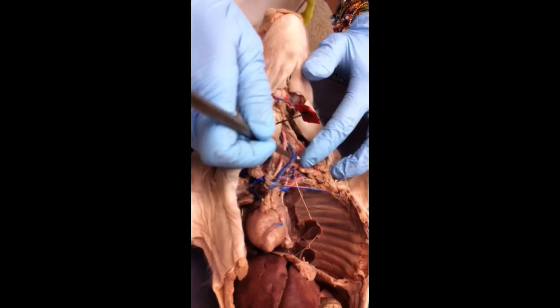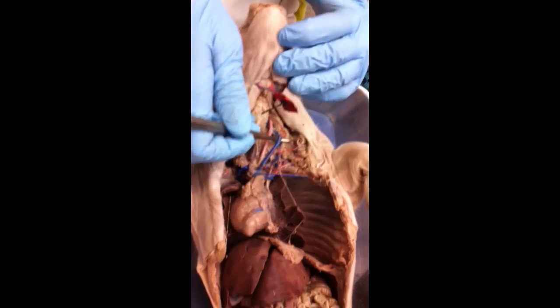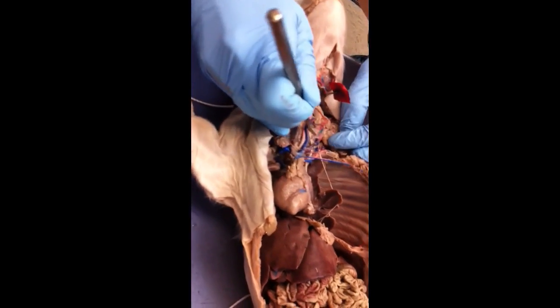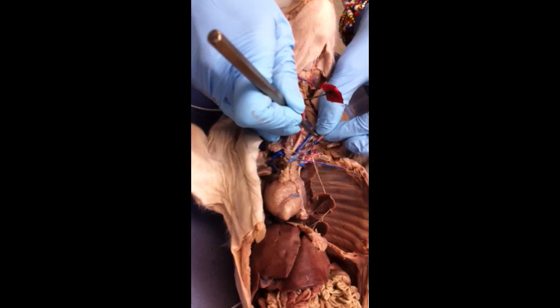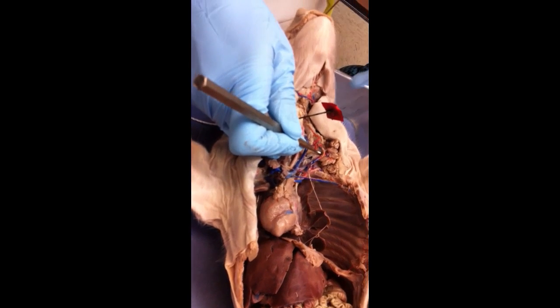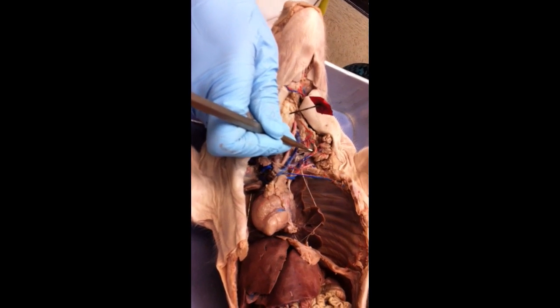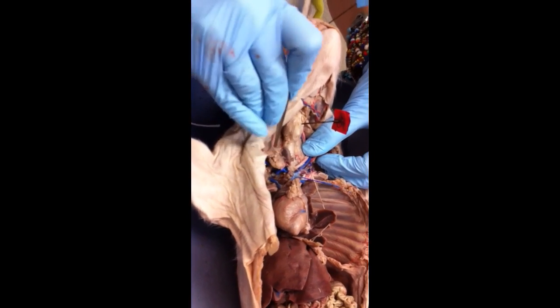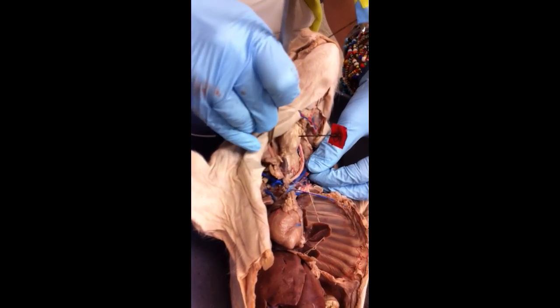So left internal jugular drains deoxygenated blood from the brain. Think inside. External jugular vein drains deoxygenated blood from the head, outside, okay? So those are those. Same on this side. So for anything that's in pairs, you would say if it's a right or a left, okay?